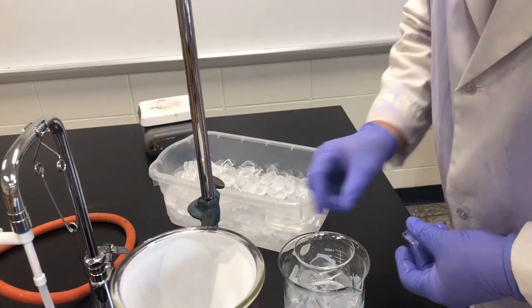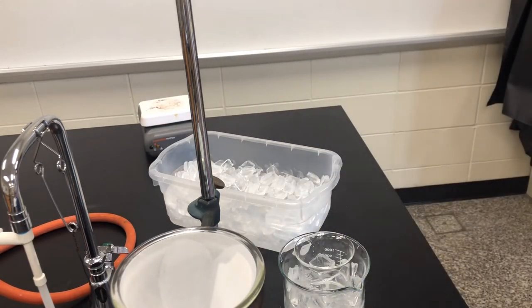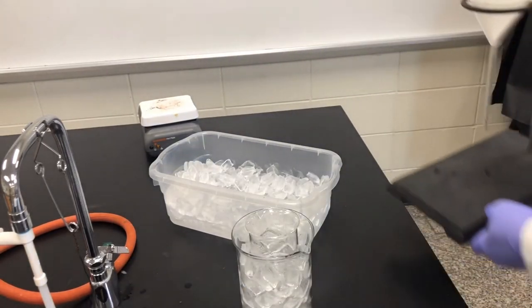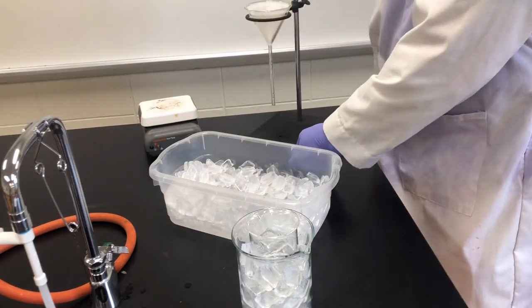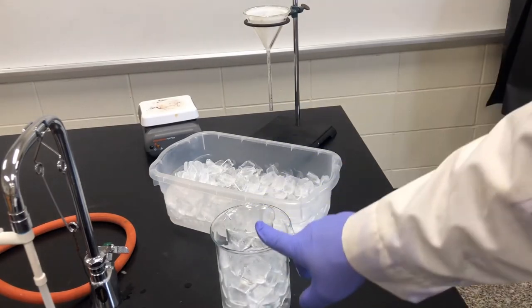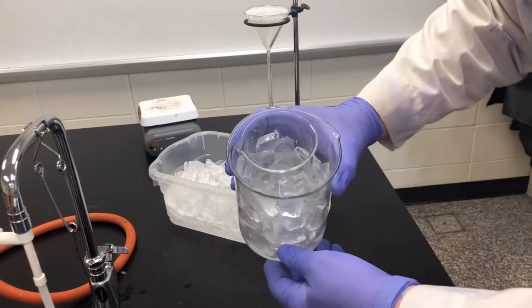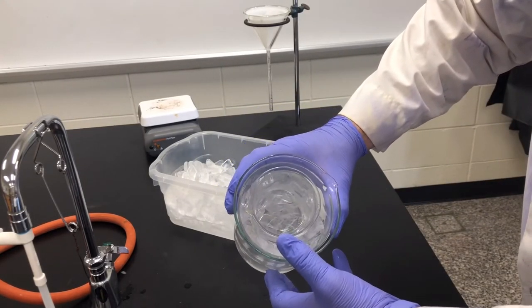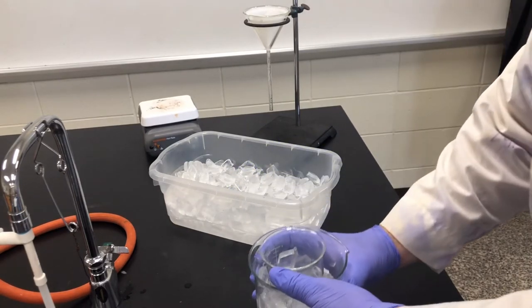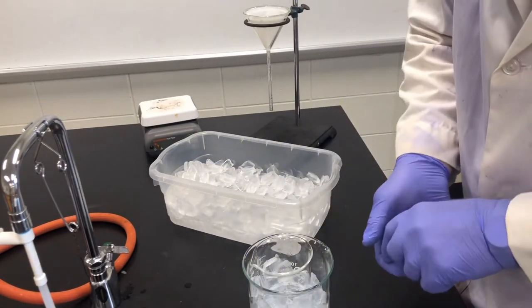And then we will let this cool off while someone else is cleaning up the other material. So what I've got here is a large beaker with ice in the bottom of it. We put in the beaker that is containing the material. Still a liquid, and we're going to let that cool until we start to see the crystals.